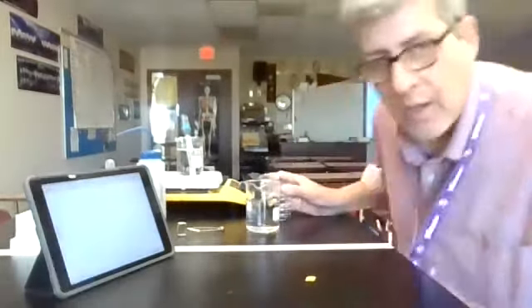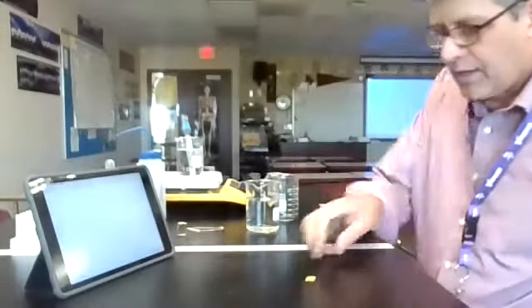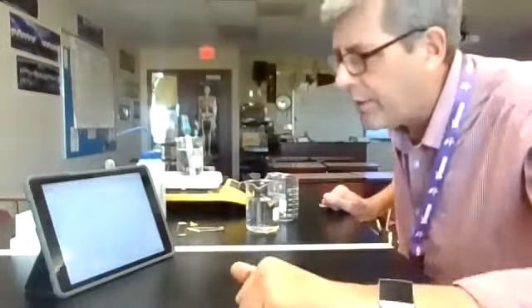And let's continue watching that as this thing is going along. I'm going to run and grab the ice. You can see what's happening. It's heating up a little bit, but not terribly much. It's sort of a plateau that we're seeing, and that's what it's going to look like when we have a phase change diagram like that. Okay, I'm going to continue to let this heat.